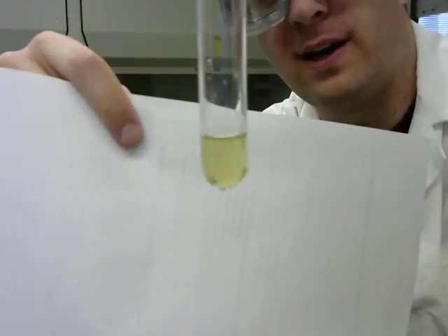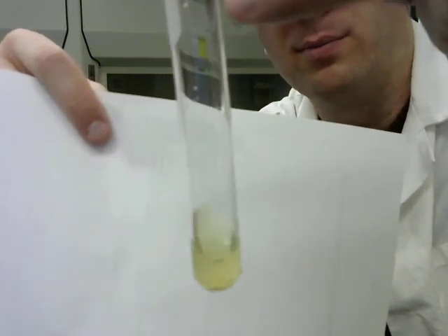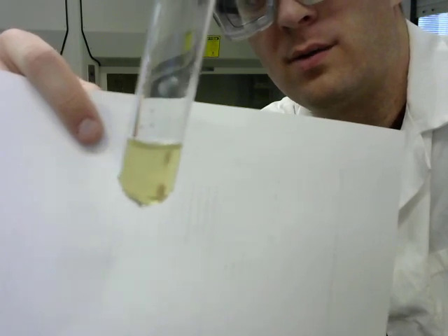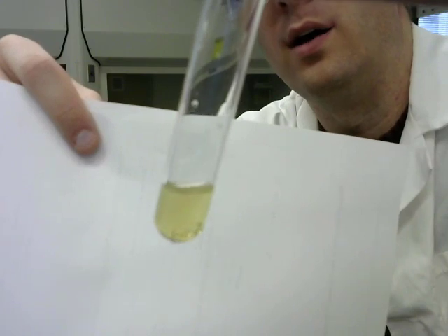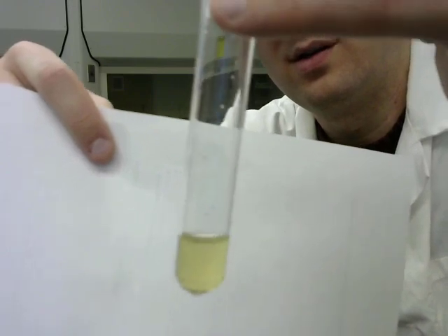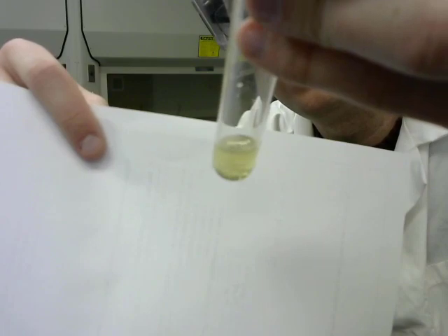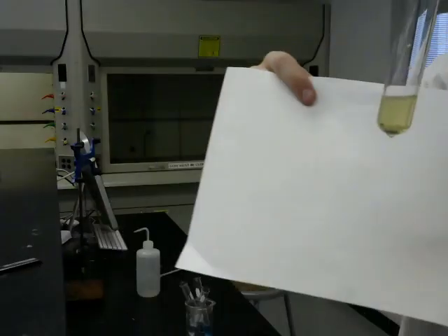And the iron sulfate had that yellow color, kind of like how the copper had the blue color. We're actually producing bubbles here, which I think might just be the zinc reacting with water. Okay, and we'll come and look at this again in a moment.